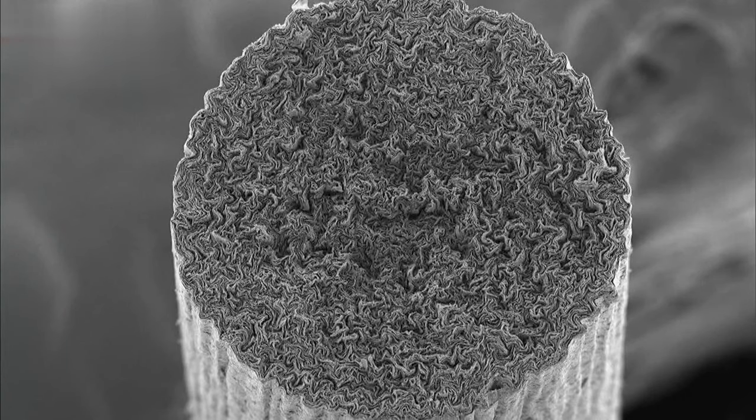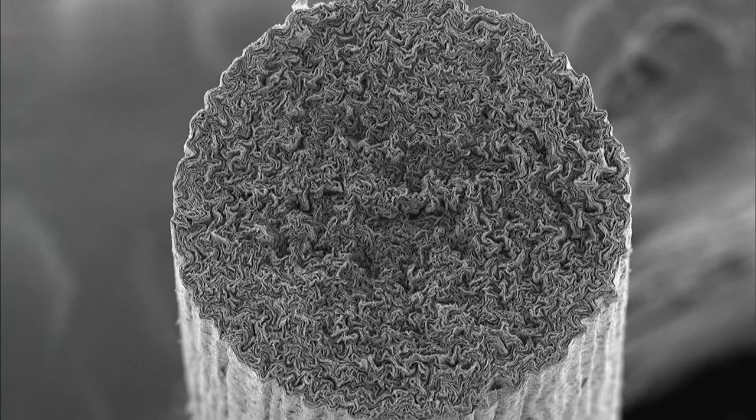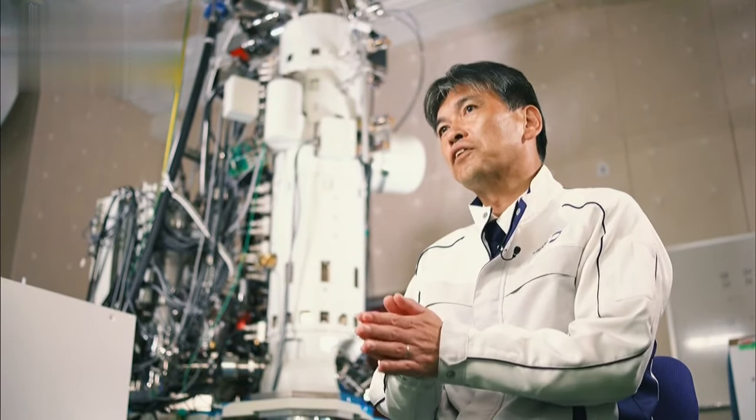Whether you're researching materials or living things, it depends on your goal, but an electron microscope really allows you to carefully observe the structure of the sample.